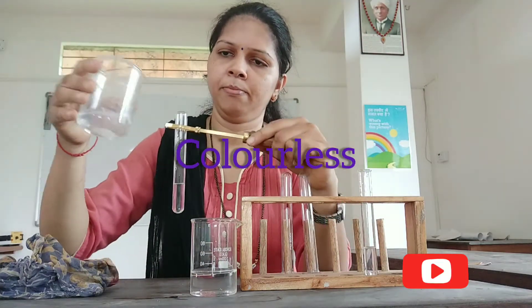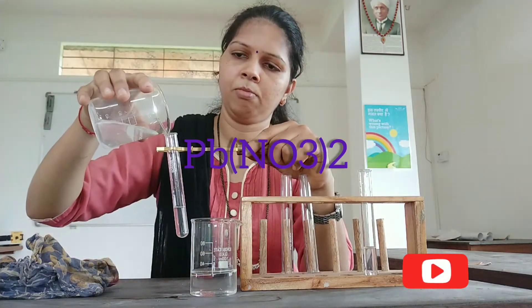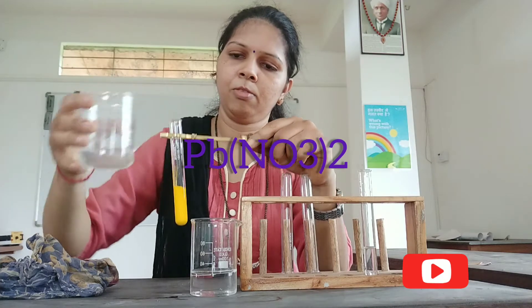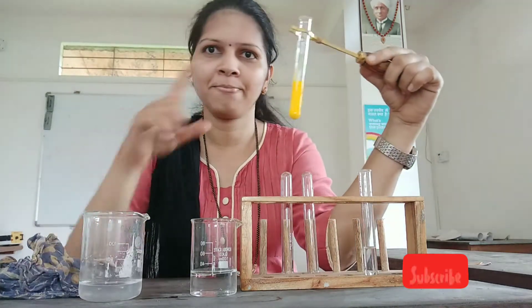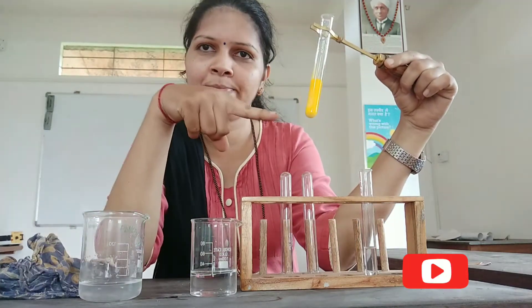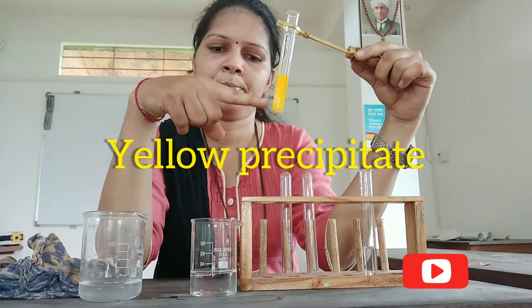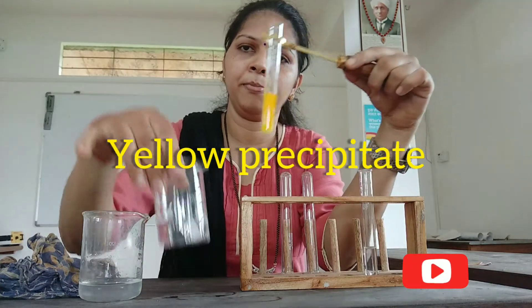Now let me add lead nitrate solution to this test tube containing potassium iodide. What do you observe? You will observe that a yellow color precipitate is formed.